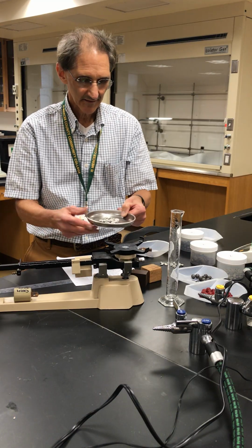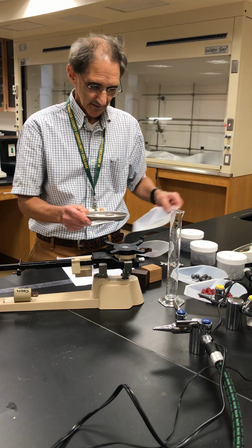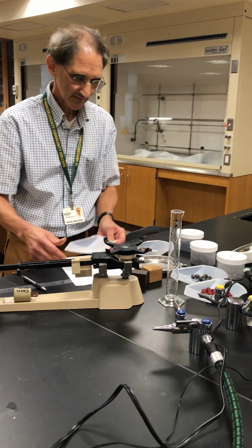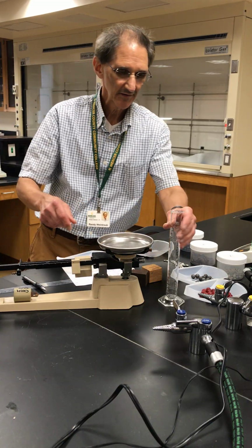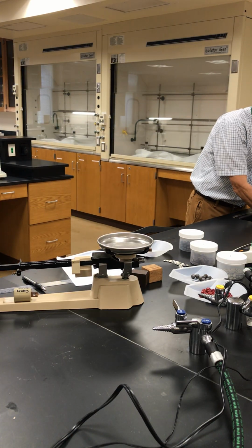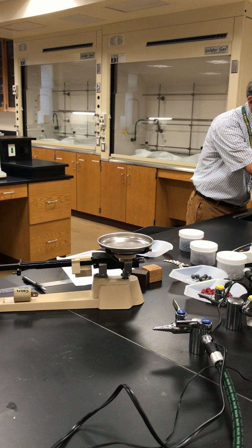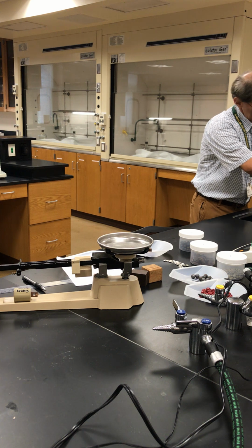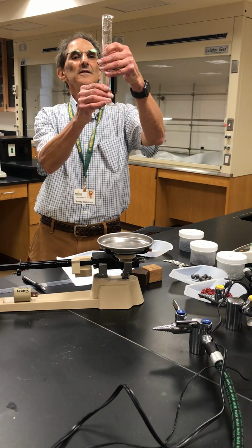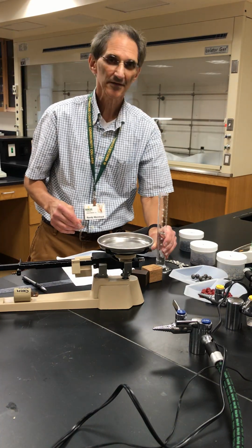Okay, so now can't possibly measure these. These are not an object that you can measure and get the volume. So what we're going to do is I'm going to put them back here, have the mass of this, and I'm going to make use of the graduated cylinder. And so at about halfway, I have 60.00 milliliters on this.